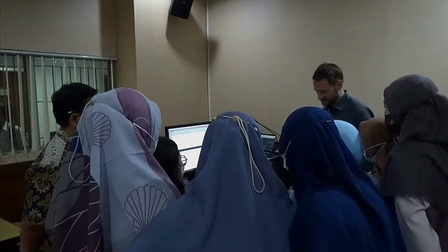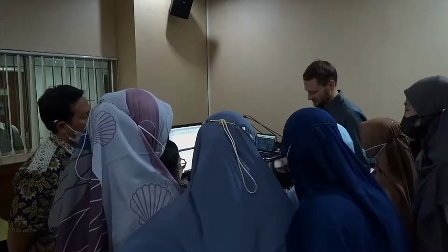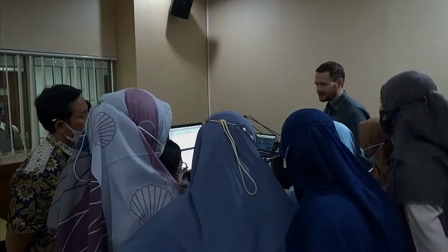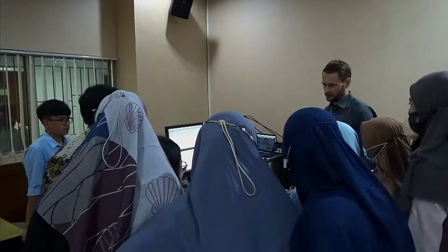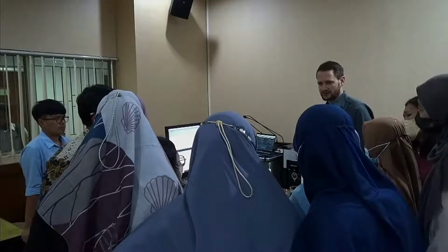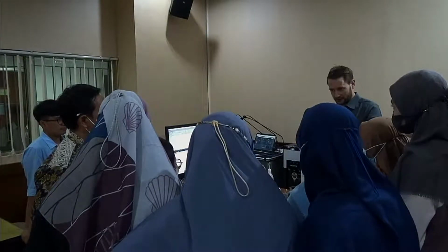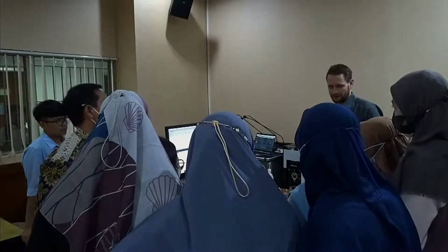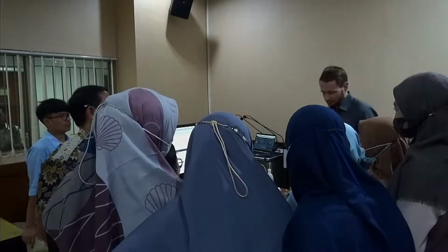So you'll see, you have one package and you'll see how much I add per one measurement. It should last quite long, and even if that is empty, this is, as I said, not a very expensive thing to buy. If you use the NIST traceable standard, a single measurement, and I'm talking just about one measurement, will cost you more than 100 euros. So if you do anything wrong, you wasted 100 euros. So feel free to do so if you want.